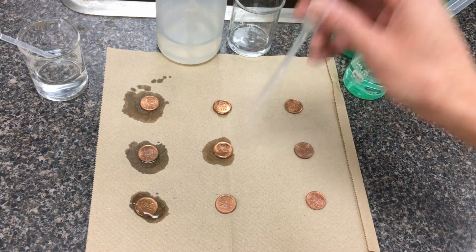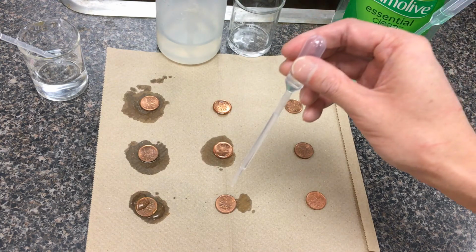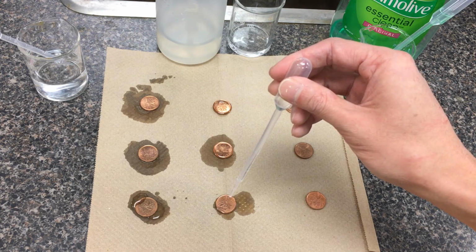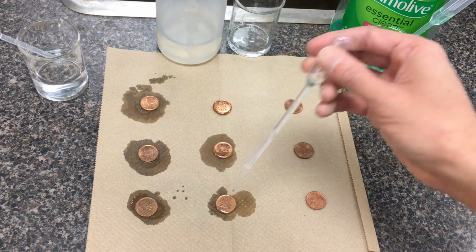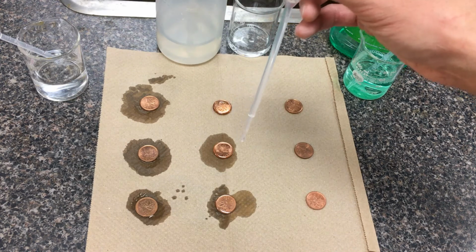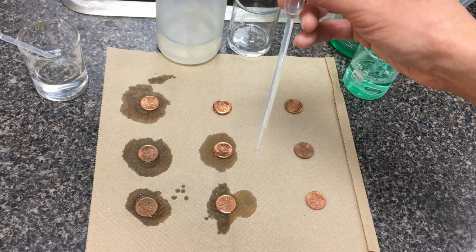Sometimes it's just splashing as I'm lowering the methanol solution, so we need to look out for that. So 1, 2, 3, ... maybe somewhere around 10 or 11 for that one. You're going to find that with methanol, the dropper even has trouble actually holding the solution inside. That's a qualitative observation we could make.